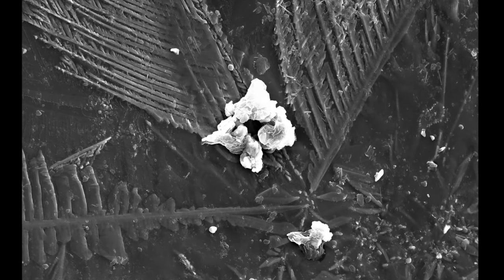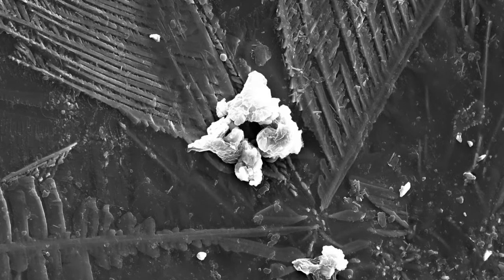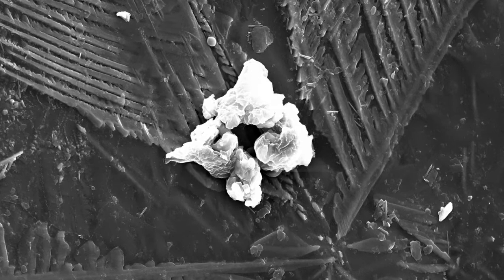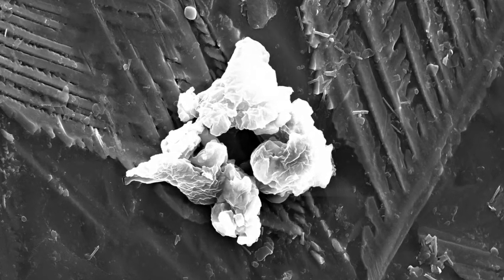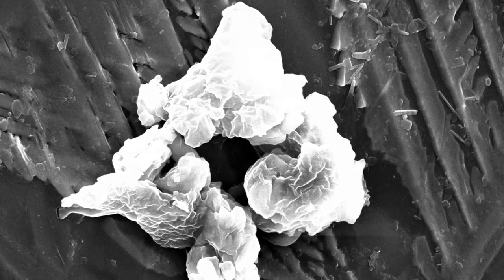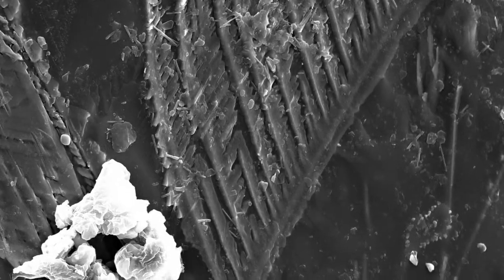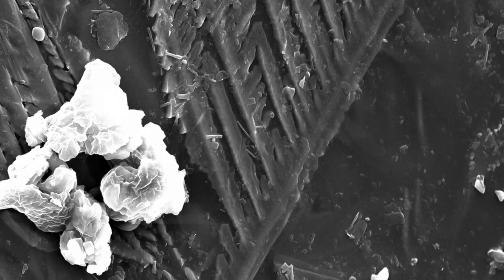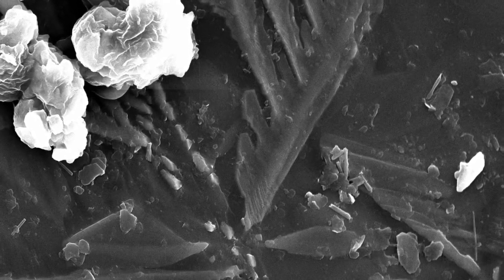And I wanted to show this because this kind of central structure, this big white dot right in the center, is, believe it or not, a piece of kiln wash. So anytime you are kiln shelf grinding, this is what the dust that you kick up looks like at 5,000 magnification. We've got these really large iron silicate crystals growing from these kind of central seeds.